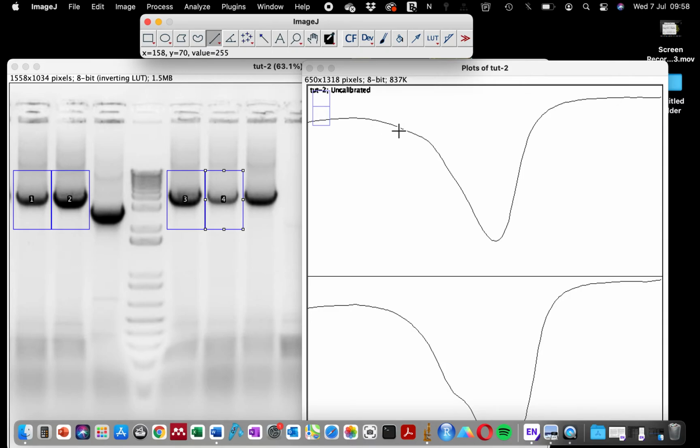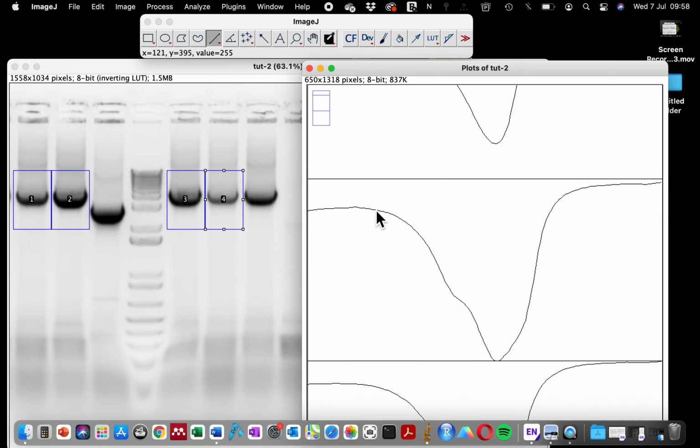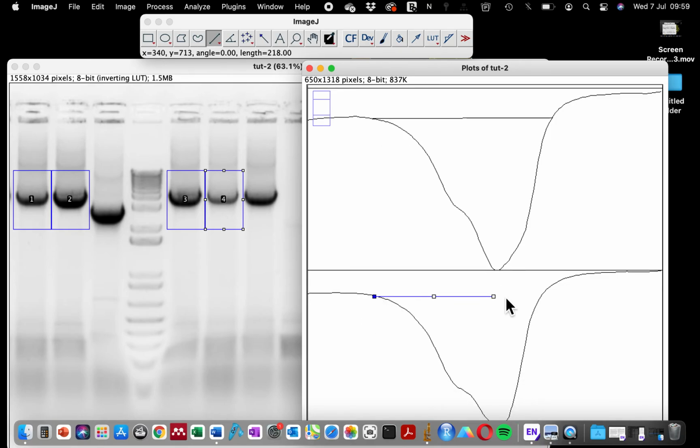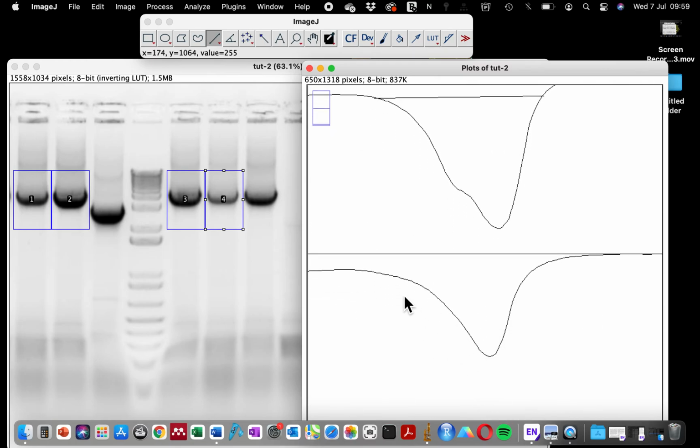So all you have to do is to draw a connecting line that has to touch. This line must touch. If it doesn't touch, you will get an error message and I will troubleshoot that with you in a few minutes. So let's just do this. It doesn't matter if your line exceeds the connecting point. It's better for them to touch than not to touch.